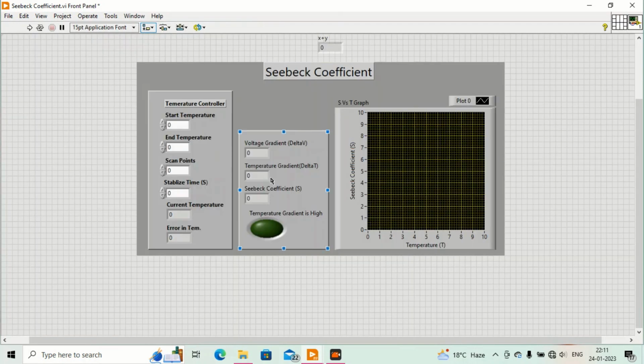Let's come to the block diagram. This is the iteration. We have put it for settings. Suppose we have selected the start temperature as 100 and end temperature as 200 and 10 scan points. So it means we have to start from 100 and go to 200, and there should be 10 scan points. Okay, so I will run this program.